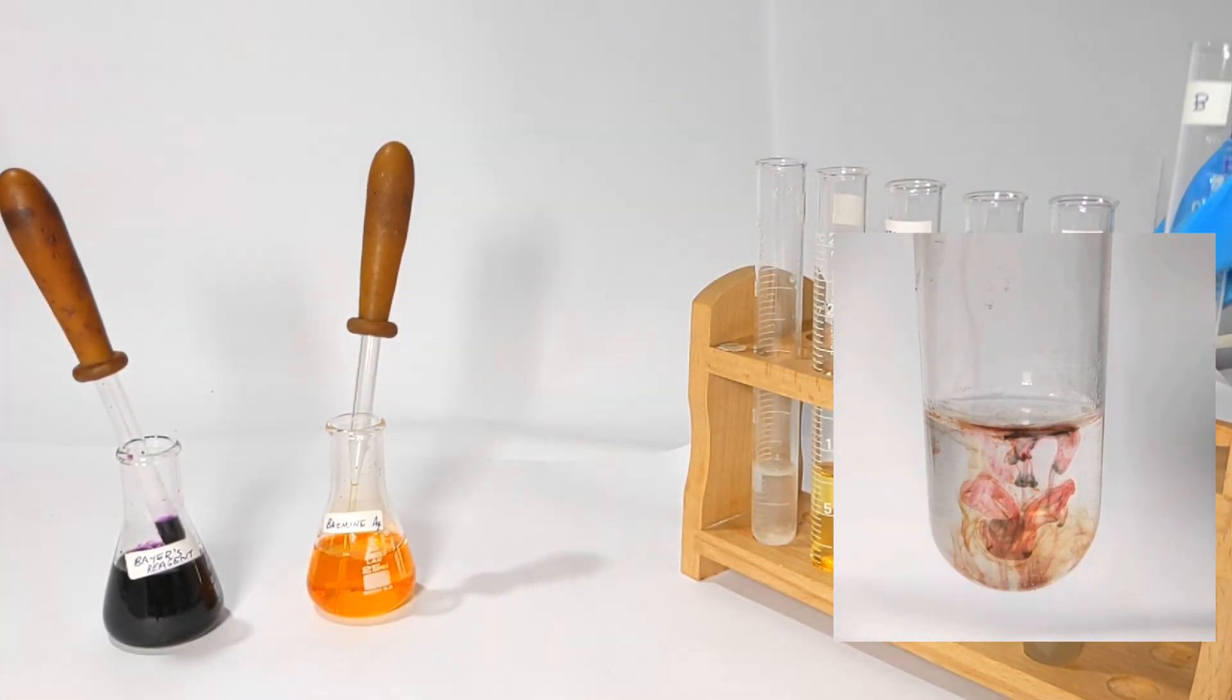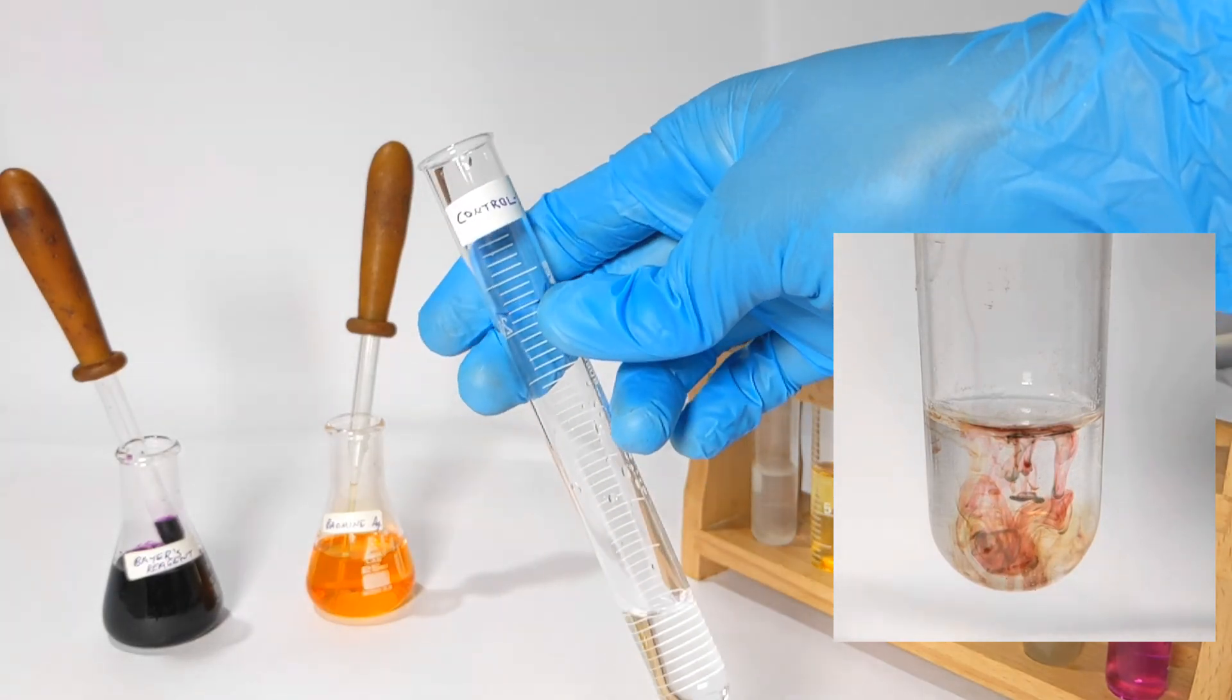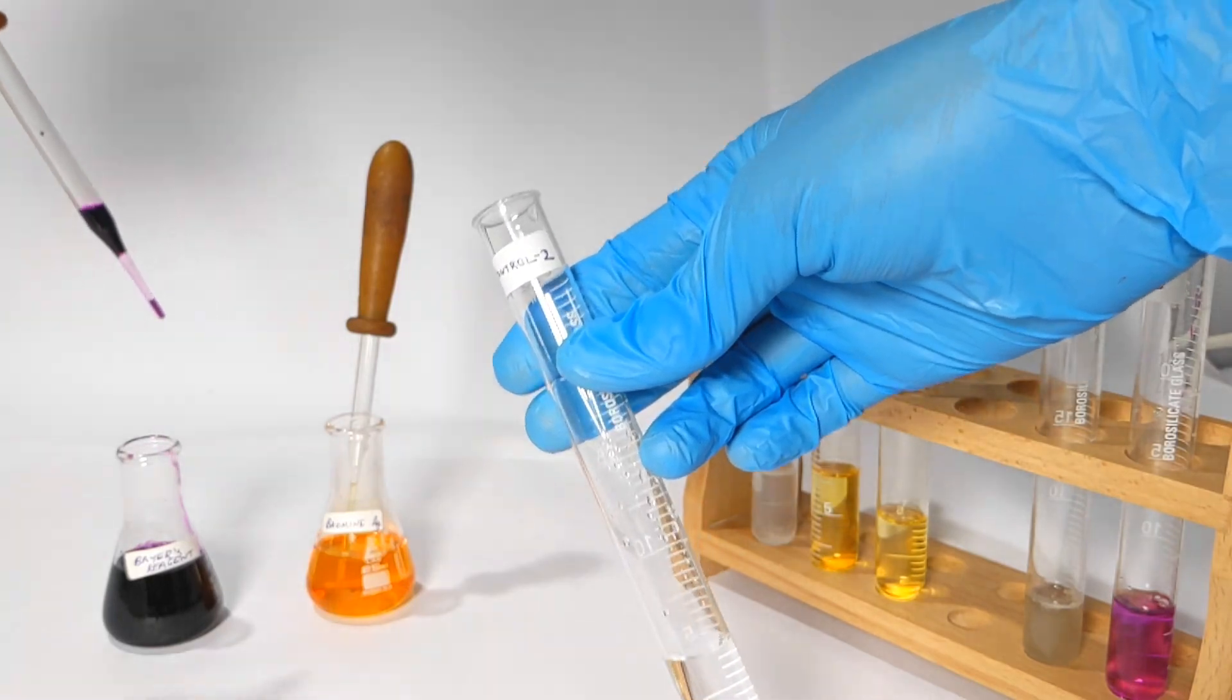And finally the control solution which has pure water kept for completion sake shows the similar response as in test tube B indicating that there is no reaction in test tube B.